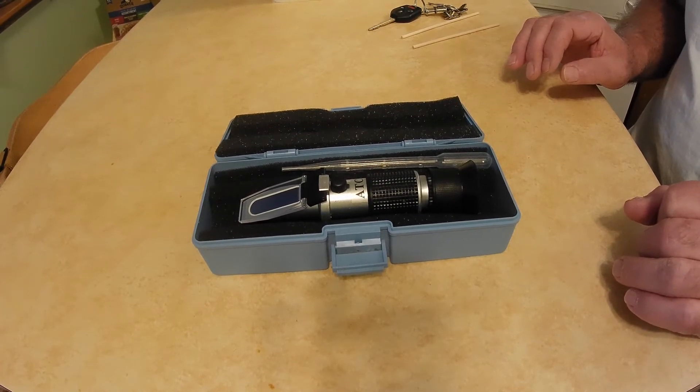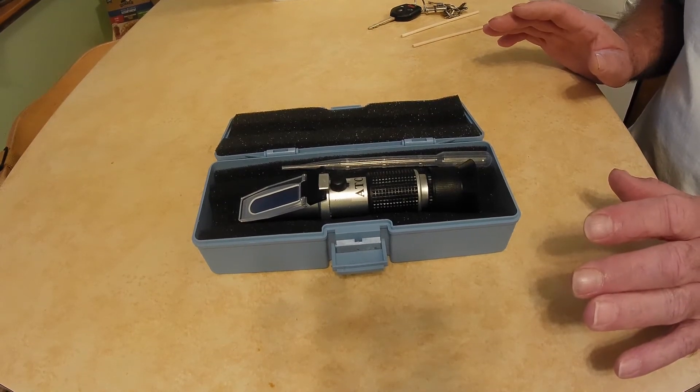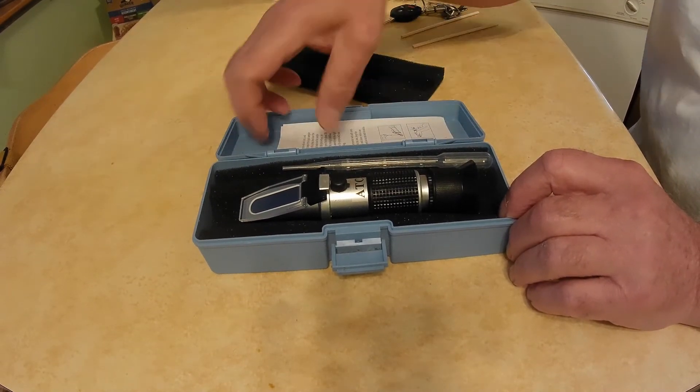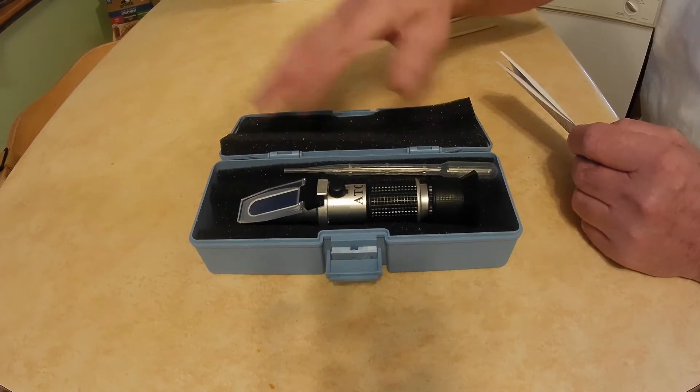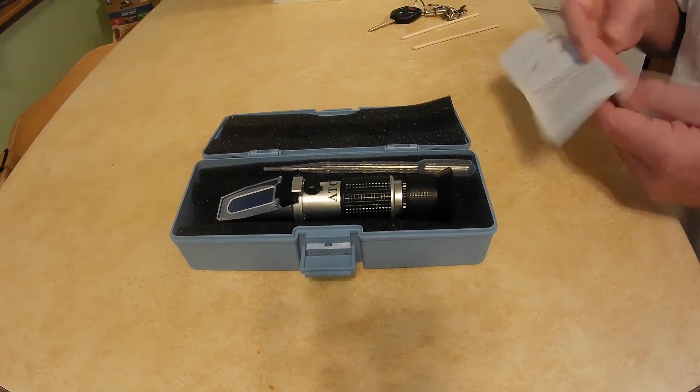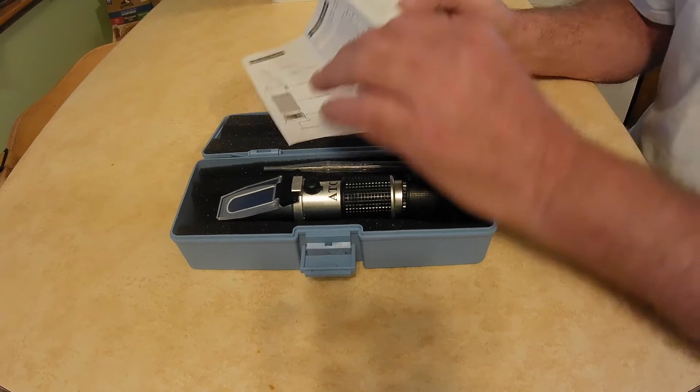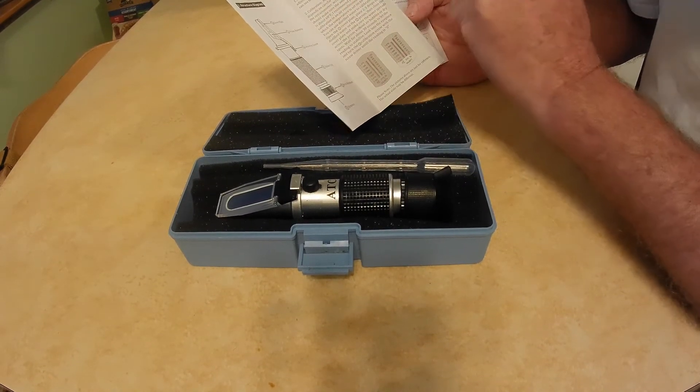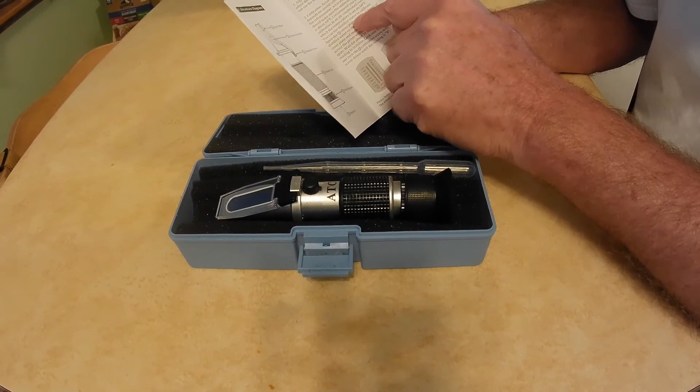When I first got it, I didn't know what I was really doing with it because under this foam you'll get a list of instructions on what to do. And in these instructions, the first thing it tells you to do is to calibrate the device with distilled water.